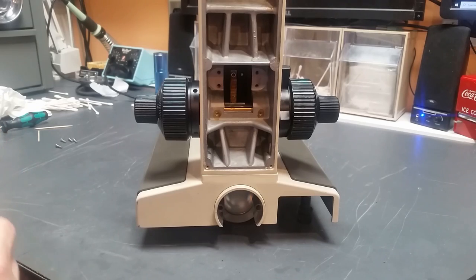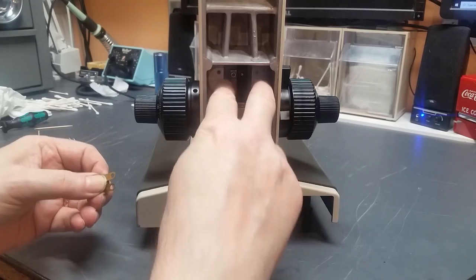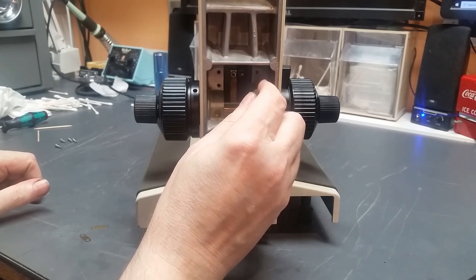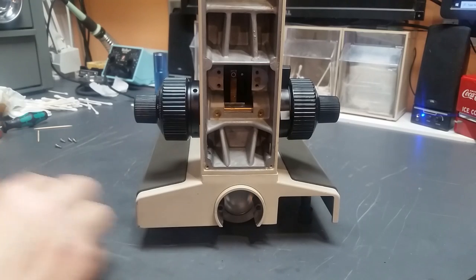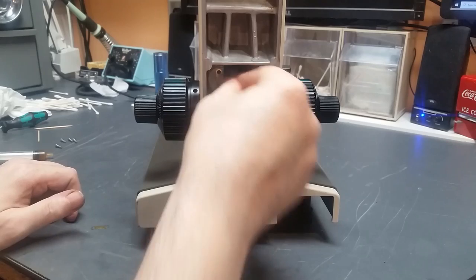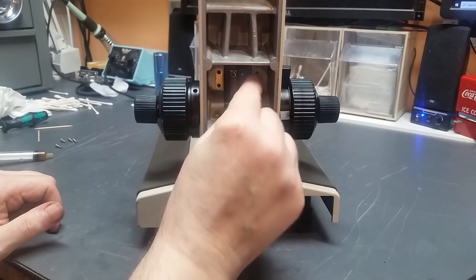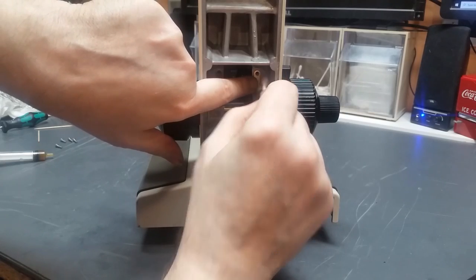And if you will recall, when I took this apart, these two brass shims that should have been behind the gearbox were not present. And I've got a couple of them. I'm going to put those in. The way I do that is I just put a little dot of grease on the wall inside the casting there where they go. And then I just stick these in place. The grease holds them there. And at that point I can install the gearbox and everything is a lot easier. Let me reach in and take out some of that excess grease. Okay.